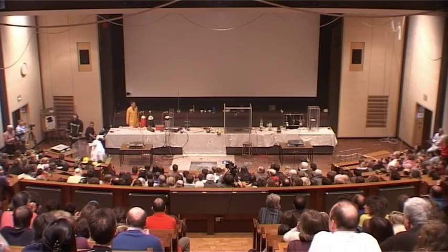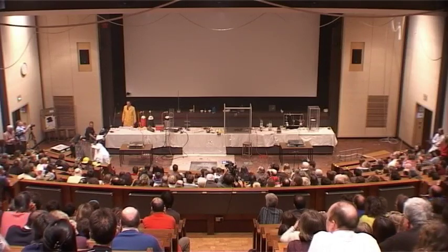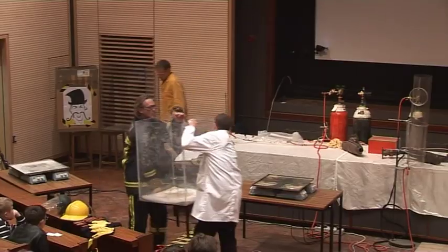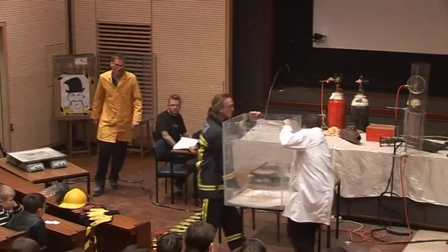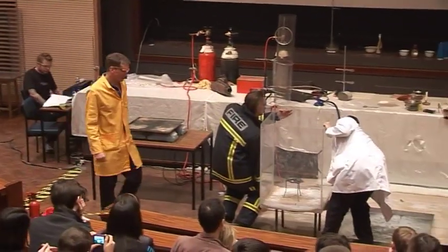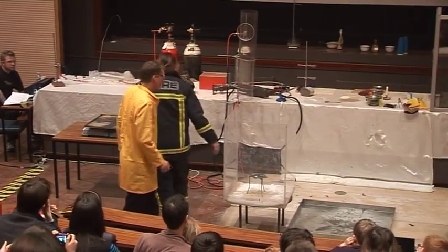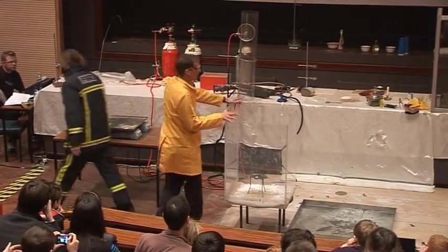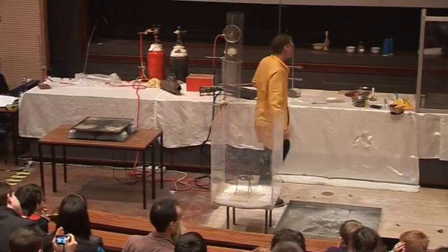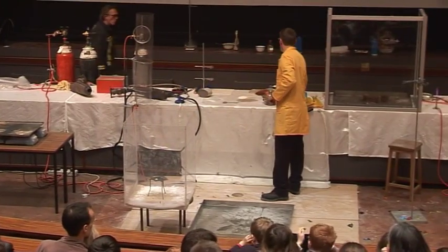The tank over here is filled with carbon dioxide gas. Carbon dioxide is heavier than air, so this tank is filled with carbon dioxide, and it should put out a fire.